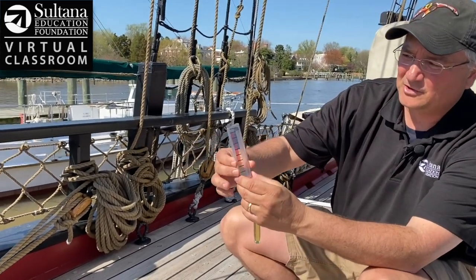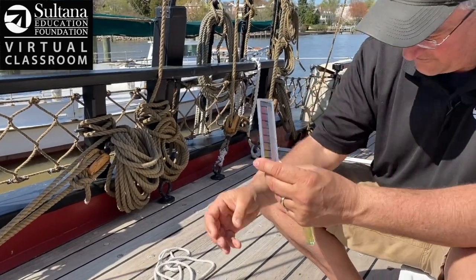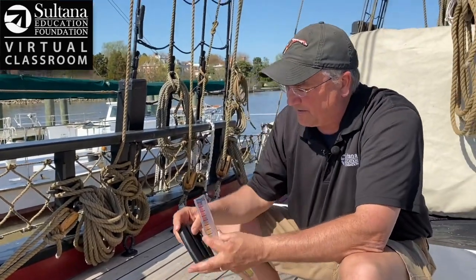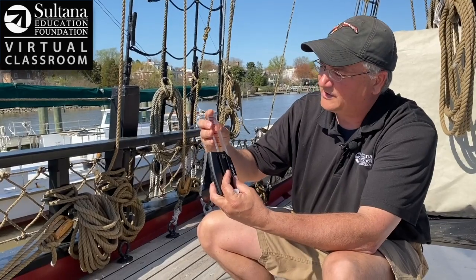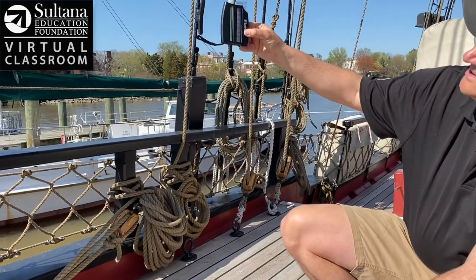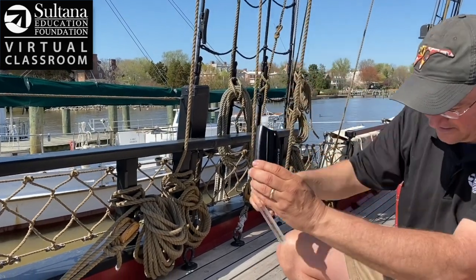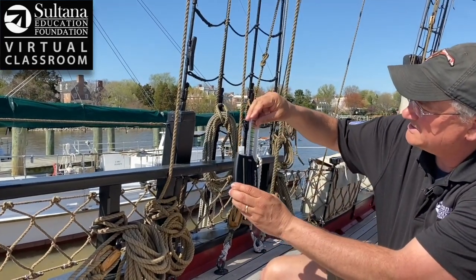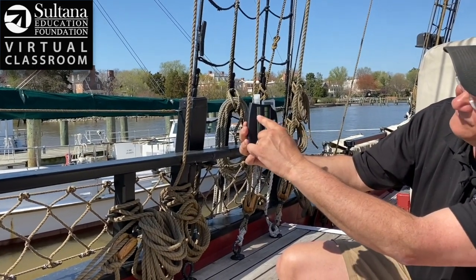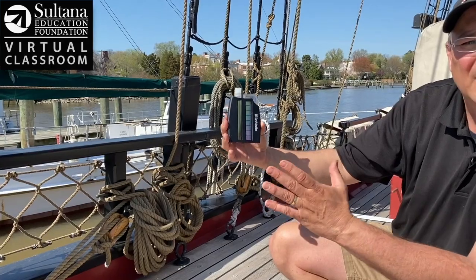I've got this color comparator, where each different color represents a different pH level. This slide measures from 3 to 6.5, but I also have a second slide that measures from 7.0 to 10.5. I'll start by putting the slide with the lower, acidic values into the comparator with the water sample, hold it up to the light, and the color looks closest to around 6.5. Looking at the higher range slide, it looks like we're between 7 and 7.5. So the pH is somewhere between 6.5 and 7.5.